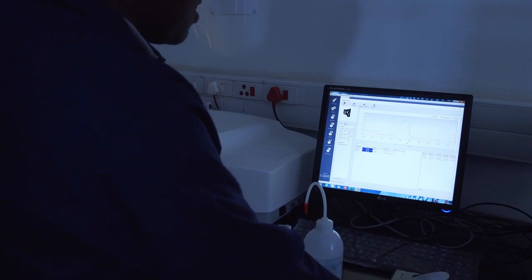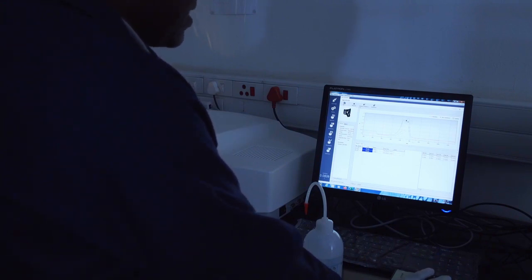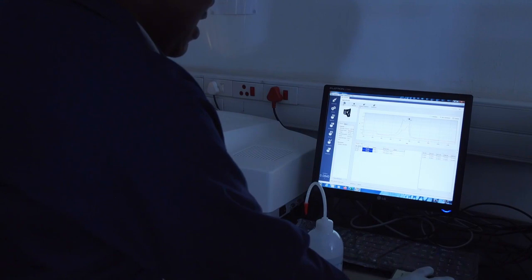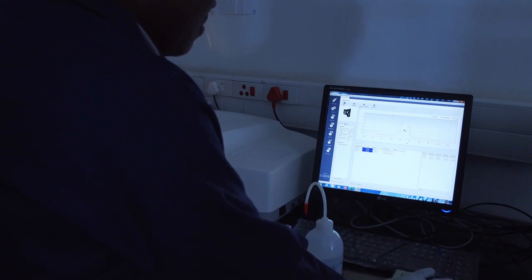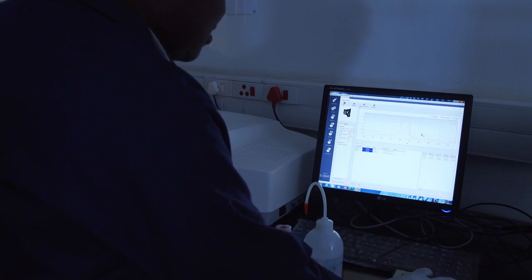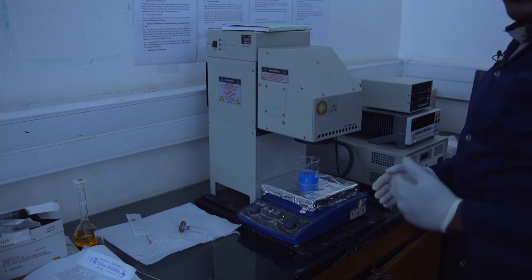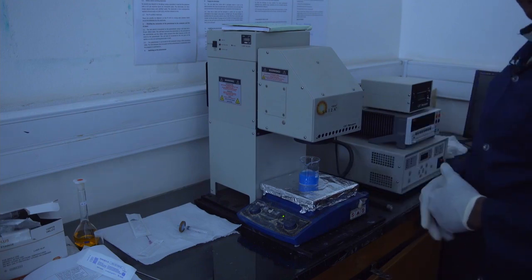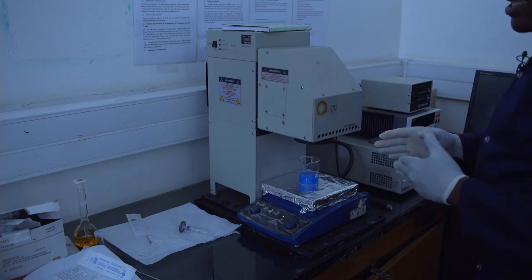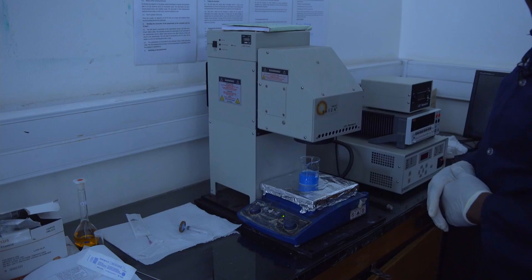As we can see from the UV-Vis spectrum of the methylene blue, the peak intensity has decreased from the initial concentration to after the equilibration experiment. After the 20 minutes equilibration reaction, we then proceed to the light reaction. This is when we switch on the solar simulator for the zinc oxide photocatalysts to start the degradation of the methylene blue dye.